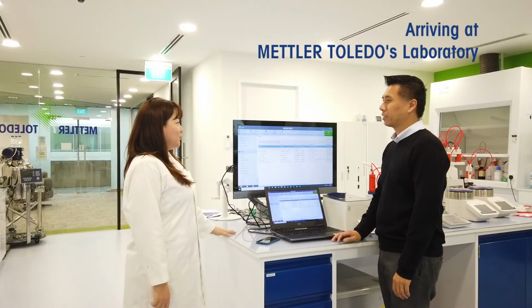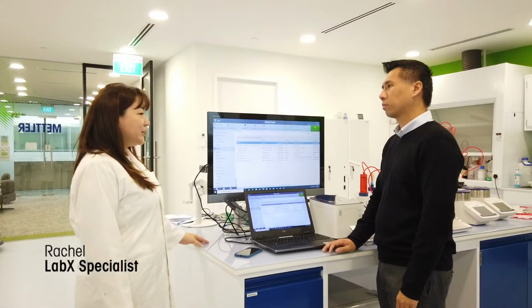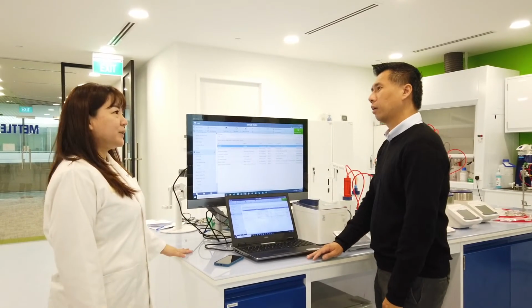Hi Wicked, welcome to METTLER Toledo. So as per our discussion, we have understood your issue. So we do have a solution for you, which is LabX software. So maybe let's take a look at what we have to offer.